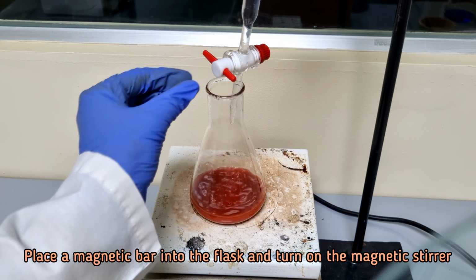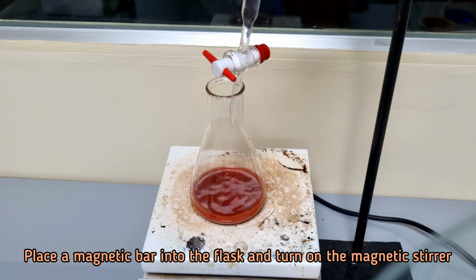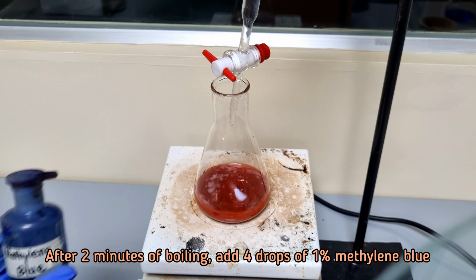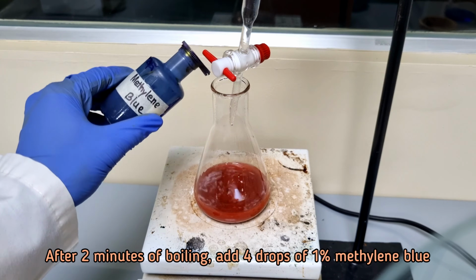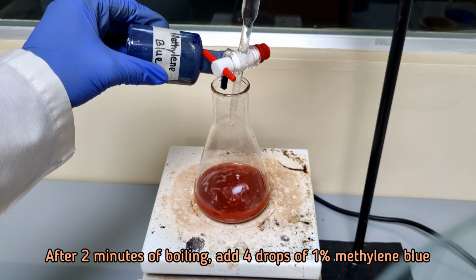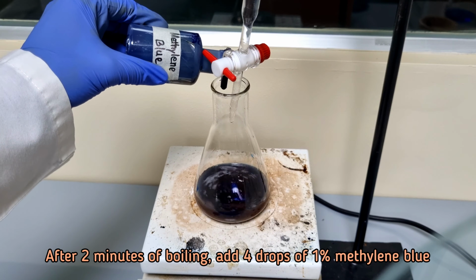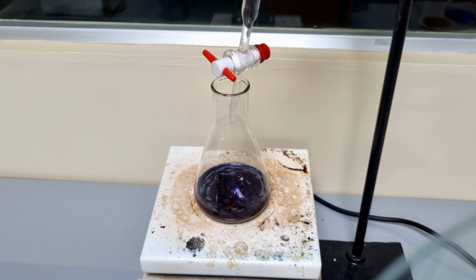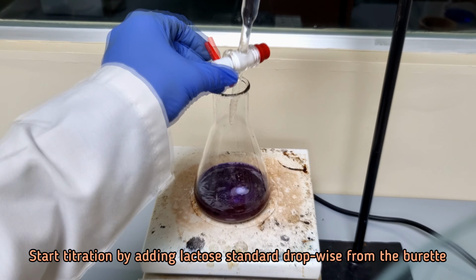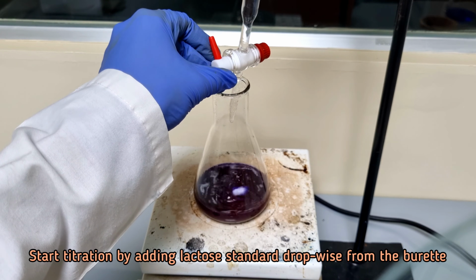Add a magnetic bar into the flask and turn on the magnetic stirrer. Boil the solution for 2 minutes. Now add 4 drops of 1% methylene blue. Let's start the titration by adding lactose standard solution dropwise from the burette.